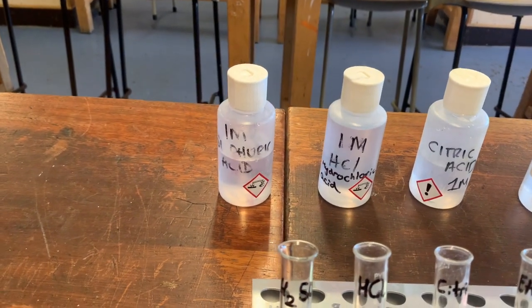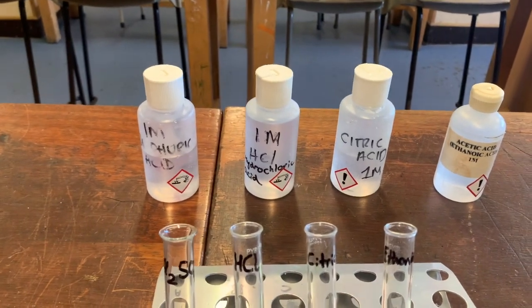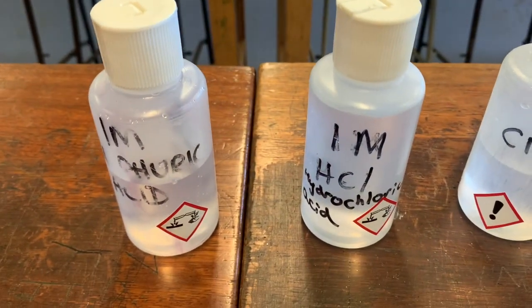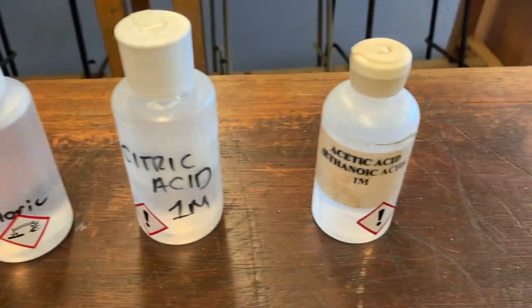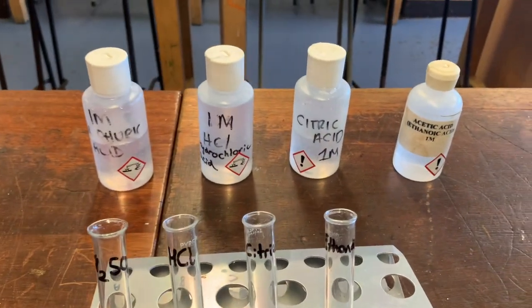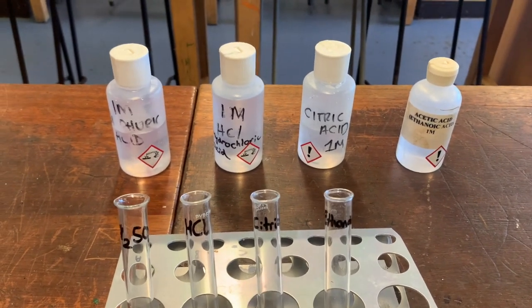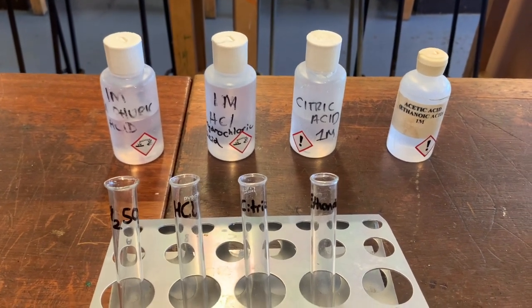In our first experiment, we're going to investigate the strength of different acids. You can see I've got four different acids here: my one molar sulfuric acid, my one molar hydrochloric acid, my one molar citric acid, and my one molar ethanoic acid. All four of these acids are one molar, meaning they are exactly the same concentration — the same number of acid particles dissolved in the same volume of liquid.